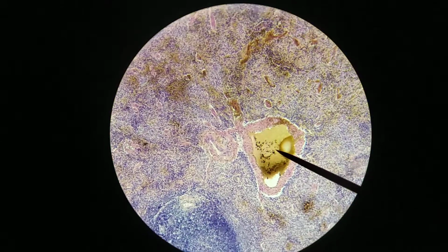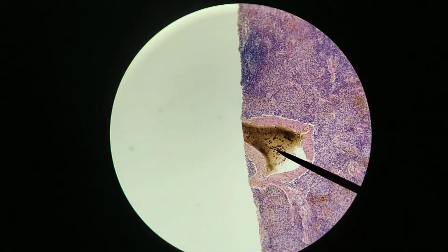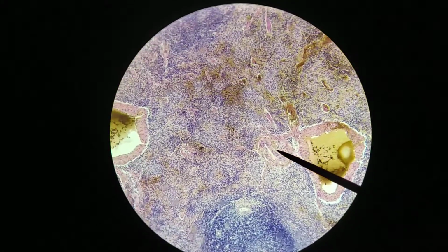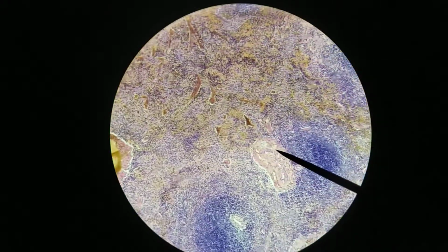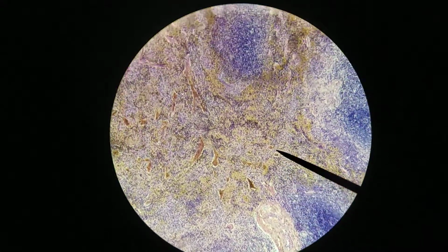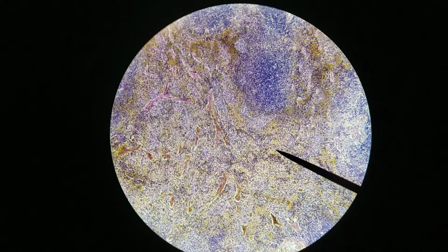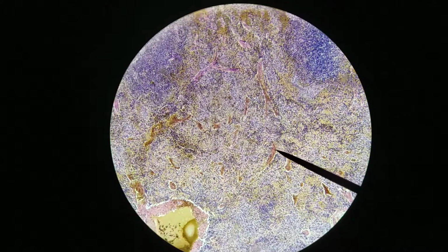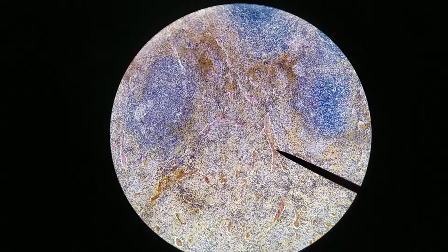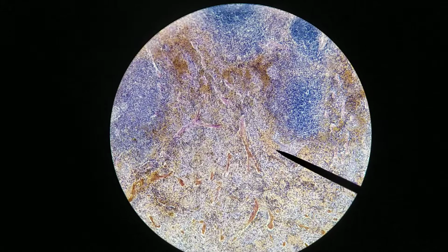Here's a trabecular blood vessel. Based on size, I'll probably say this is a vein. This is also likely to be a trabecular vein. I think there's a trabecular artery over here. Probably here as well. Okay. And this region is where we would see, or where we do see, a red pulp. Some of this kind of more dark, sort of densely staining material, those are still parts of the trabeculae, so you see that converging into the interior. But again, out here, that's the red pulp.